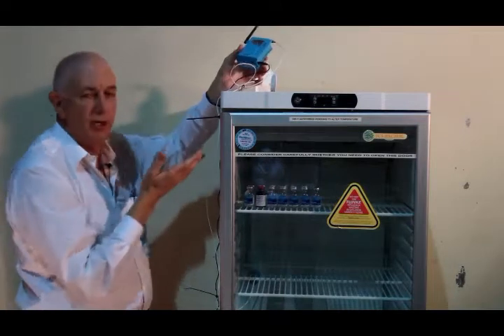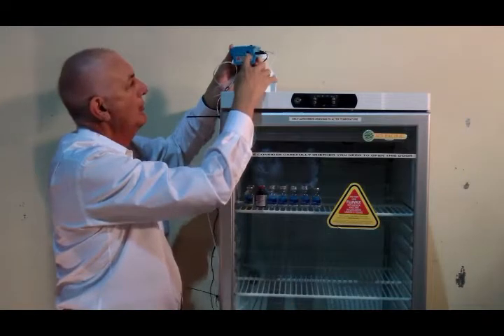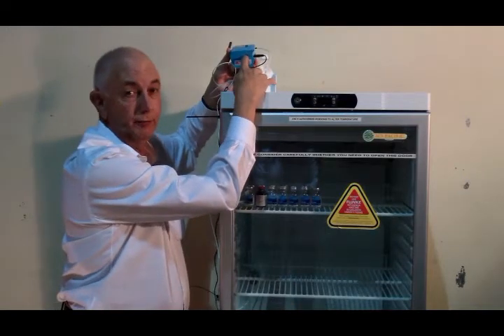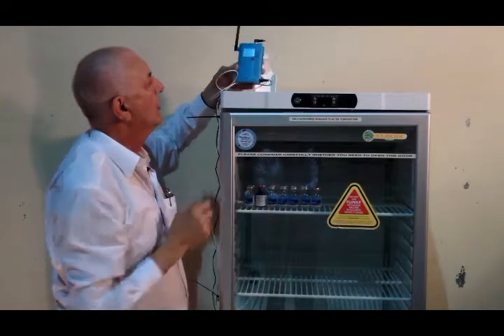So that's the logger. It's plugged into the mains. You've installed the cable into the fridge. On the bottom is a switch marked on off. Sliding the switch to on, the screen will light up.